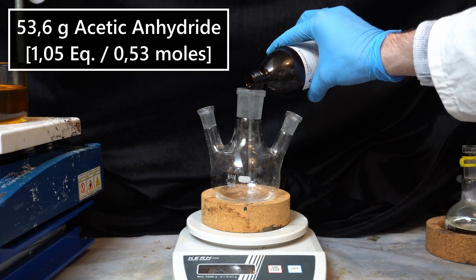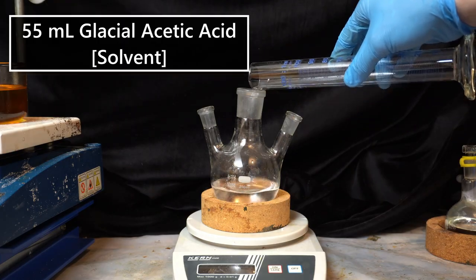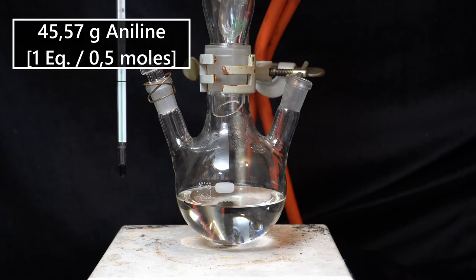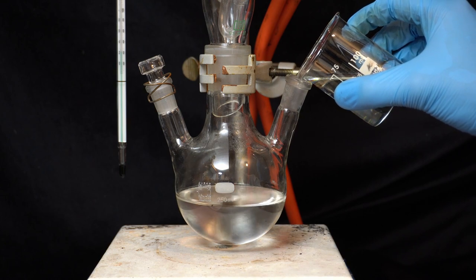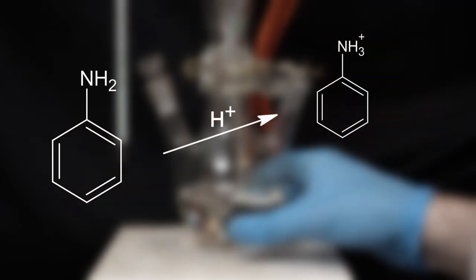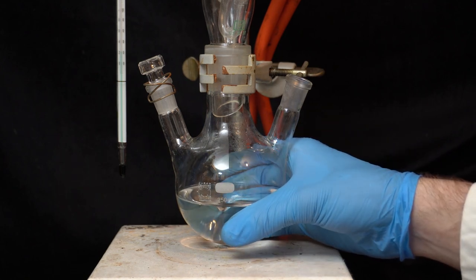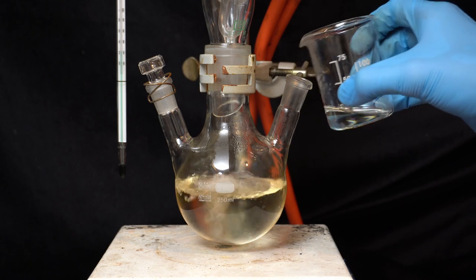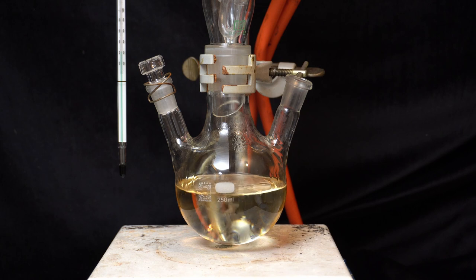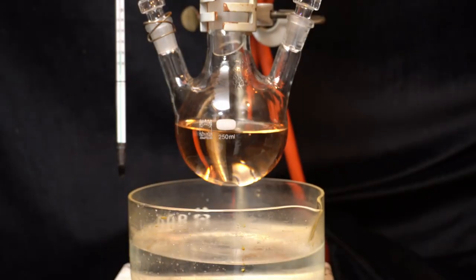53.6 grams of acetic anhydride are weighed out in a 250 mL round-bottom flask and mixed with 55 mL of glacial acetic acid. Then a reflux condenser is placed on the flask and 45.6 grams of the freshly distilled aniline are very slowly added with stirring. This process is very exothermic — the aniline is converted into its salt form as a weak base, and on top of that the reaction is also starting. You can see me feeling the temperature of the flask, and the acetic acid starts boiling just before I could add all of the aniline, so I quickly stopper the flask and cool the mixture with a water bath.